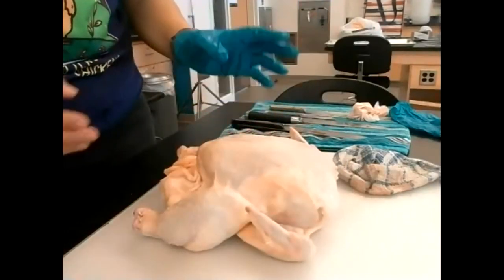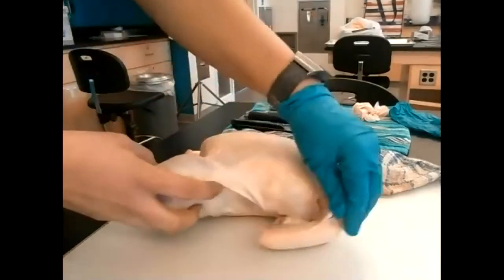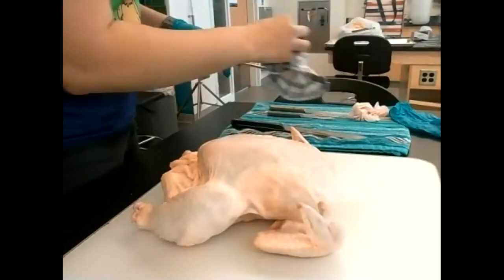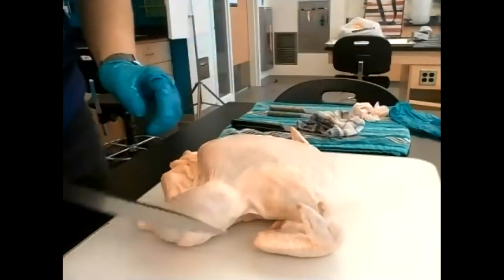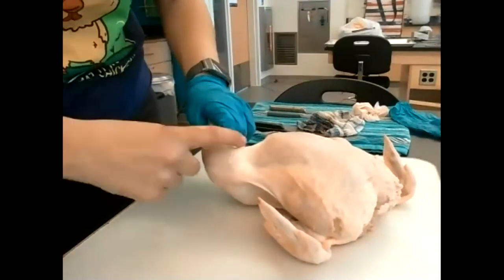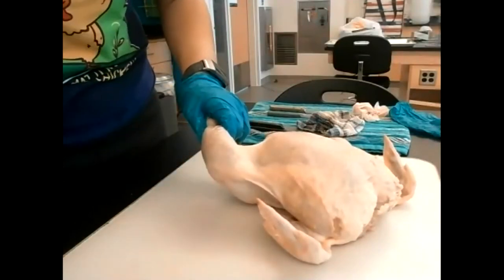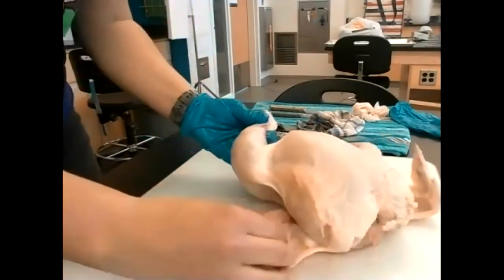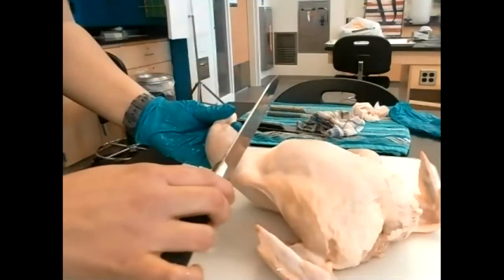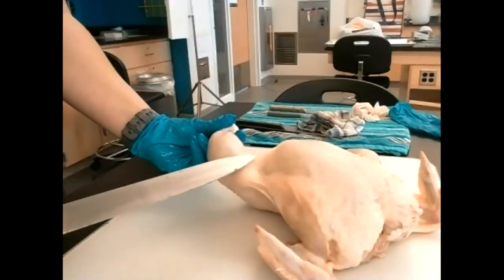The first thing you're going to do, if you have a full chicken, is remove the thigh and drumstick — the same thing you'd be doing if you were preparing this for a meal. Pull the leg away from the breast; you'll see the skin stretch and there's almost a lighter line between the breast and the leg. Then take your knife and slowly and gently cut the skin right there.